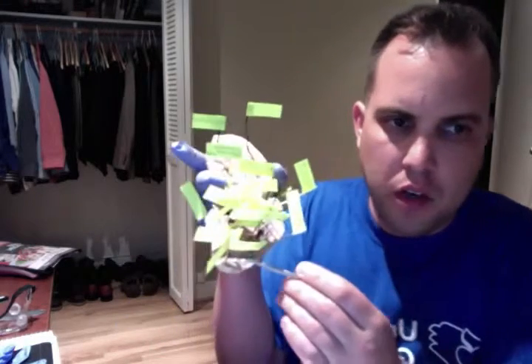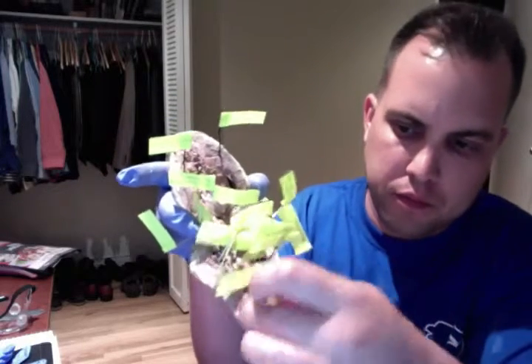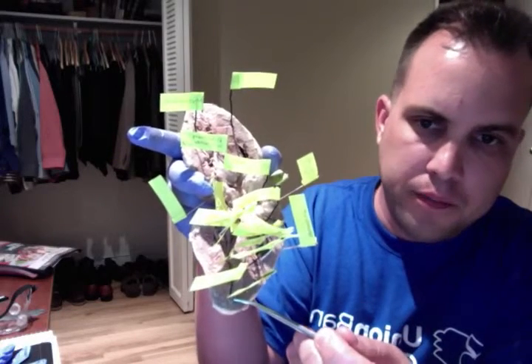I aim to dissect a sheep heart and present the different features of the heart. I will start by showing the different features and then go over each one respectively and how each works within the heart. We'll start here with the apex of the heart. This is the apex right here, down here at the bottom of the heart.